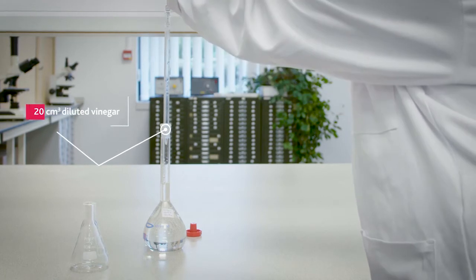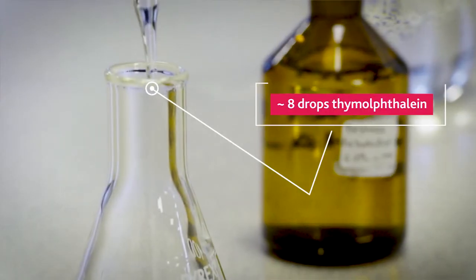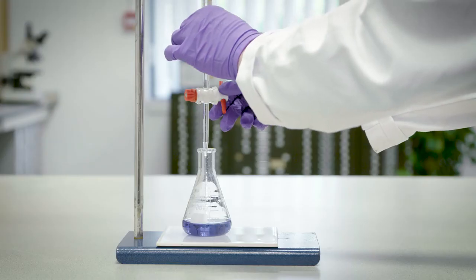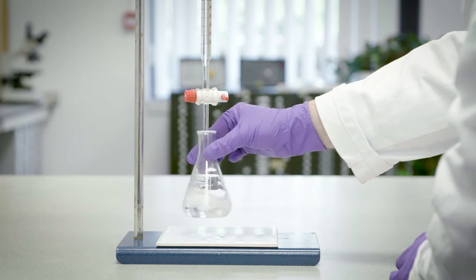Next, an accurate titer will be performed. The diluted vinegar sample is added to the clean conical flask using the pipette. Thymolphthalein indicator is added, and the conical flask is placed underneath the burette. 17 centimetres cubed of sodium hydroxide is added to the flask and is gently swirled. The blue colour that is observed will disappear.